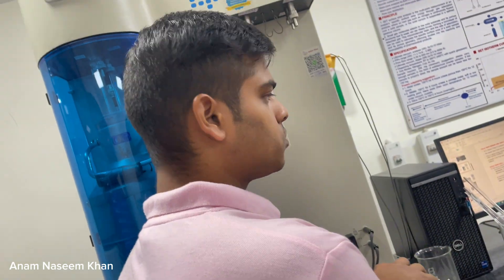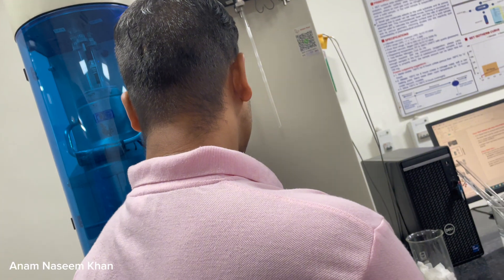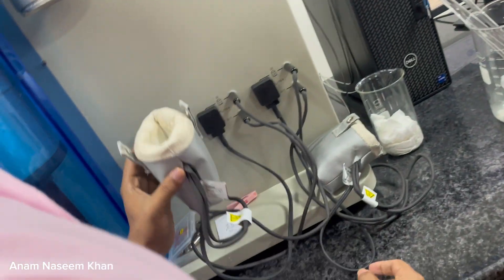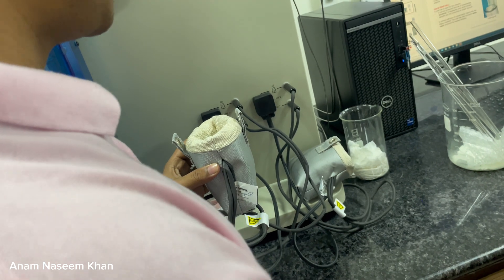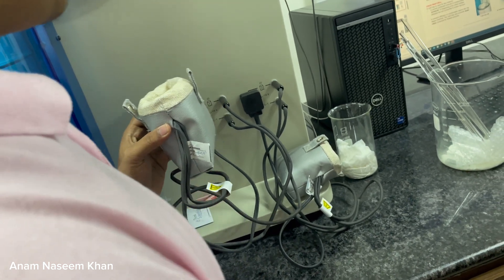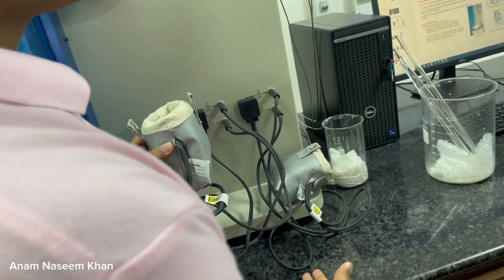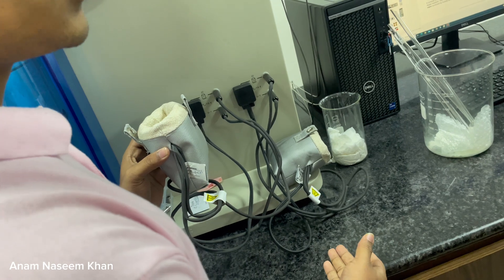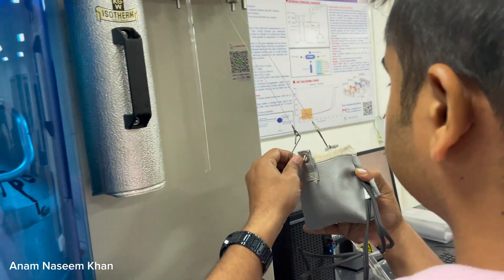At room temperature, gases can fill into the sample pores, so we have to perform degassing. For degassing purposes we use a heater here, which has a maximum temperature capacity of 350 degrees Celsius. According to your sample, you can set how many hours the degassing should run, and then you place the heater over the tube like this.